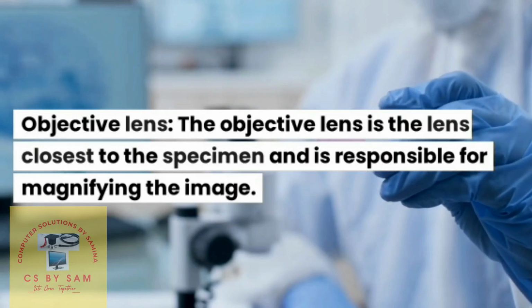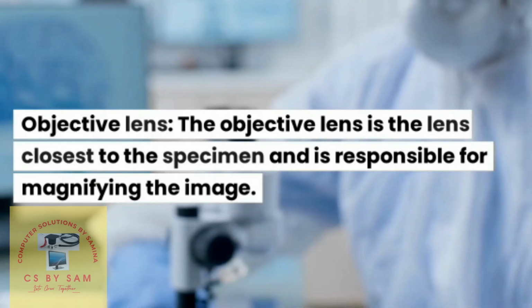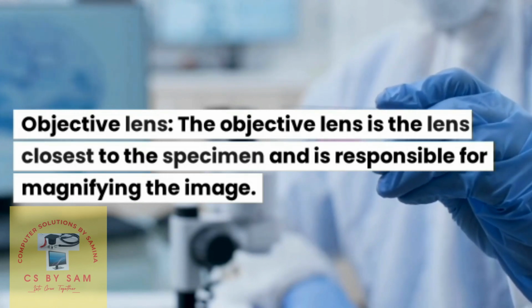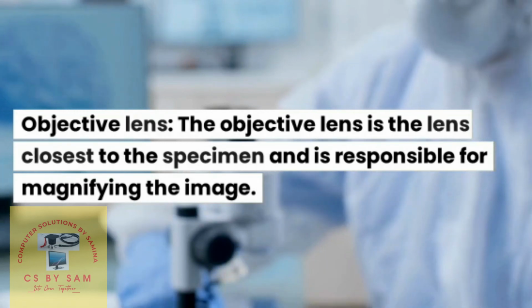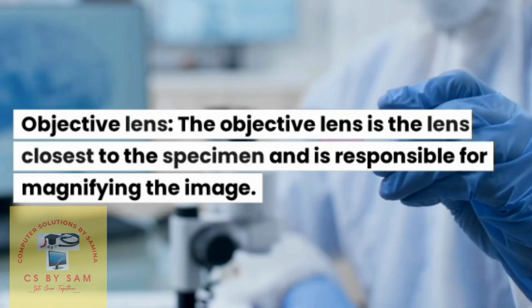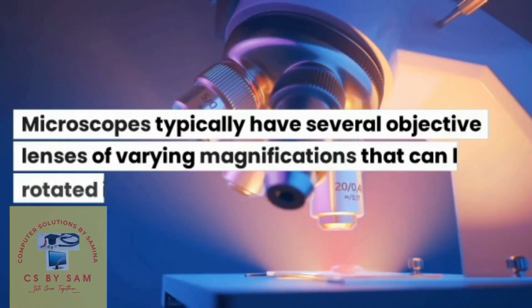Following the eyepiece lens, there are different objective lenses present in the microscope. They may be 10x, 40x, 100x, etc. The objective lens is the lens closest to the specimen and is responsible for magnifying the image.